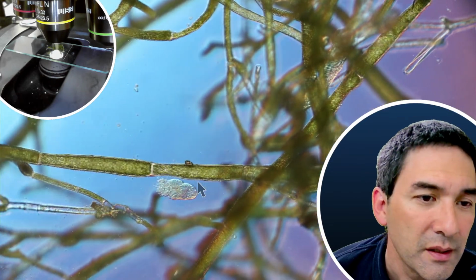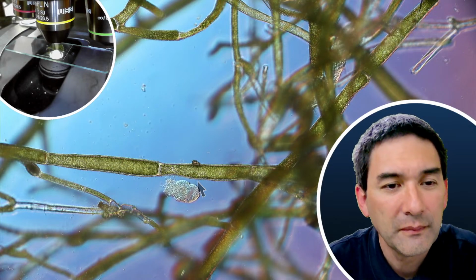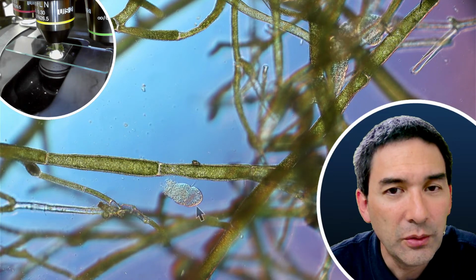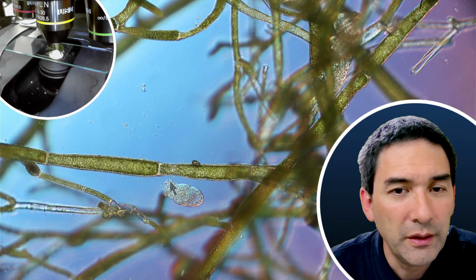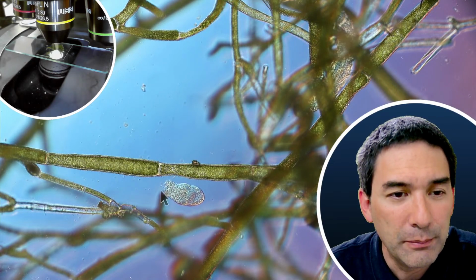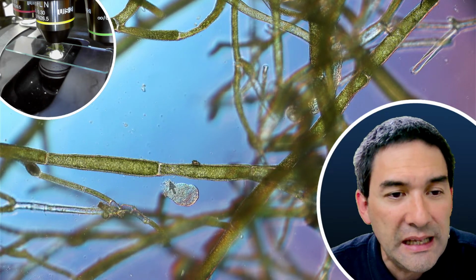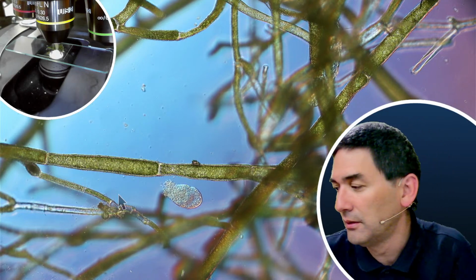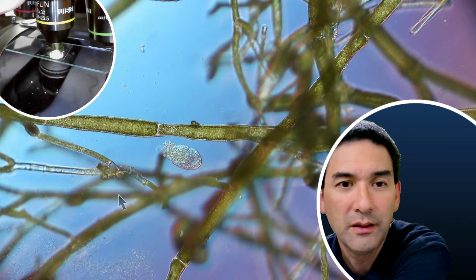Look at this. Do you see this here? This might be only the head or the tail of one of these worms ripped off, maybe as I took it out and separated it. So you see that it continues to live. If it's the head, then the chances are pretty good that it's going to grow a remaining tail. I think I kind of decapitated this worm here.